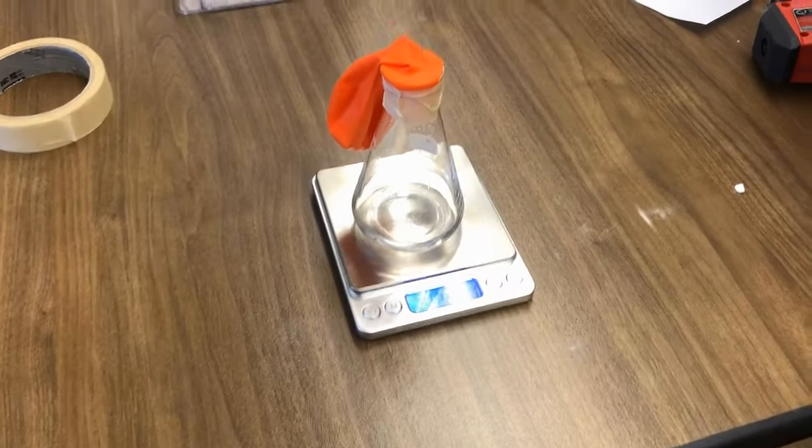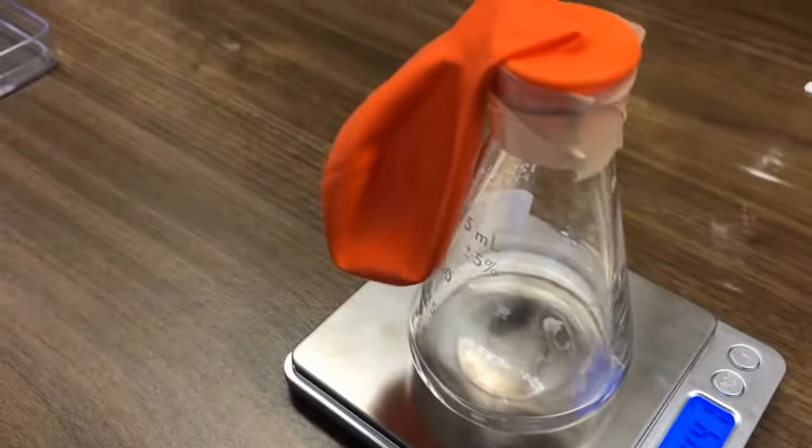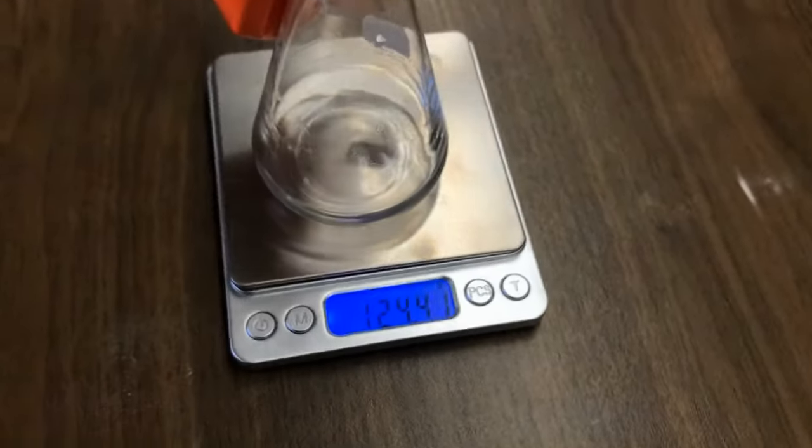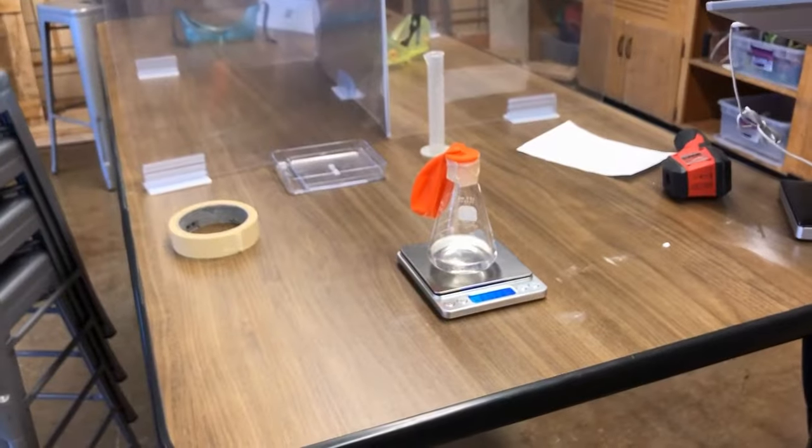They then took that balloon and put it on top of the flask and added a piece of tape so no gas could actually leave this flask or the balloon while the reaction is happening. There's the mass of the system right now, and you can go ahead and record that.